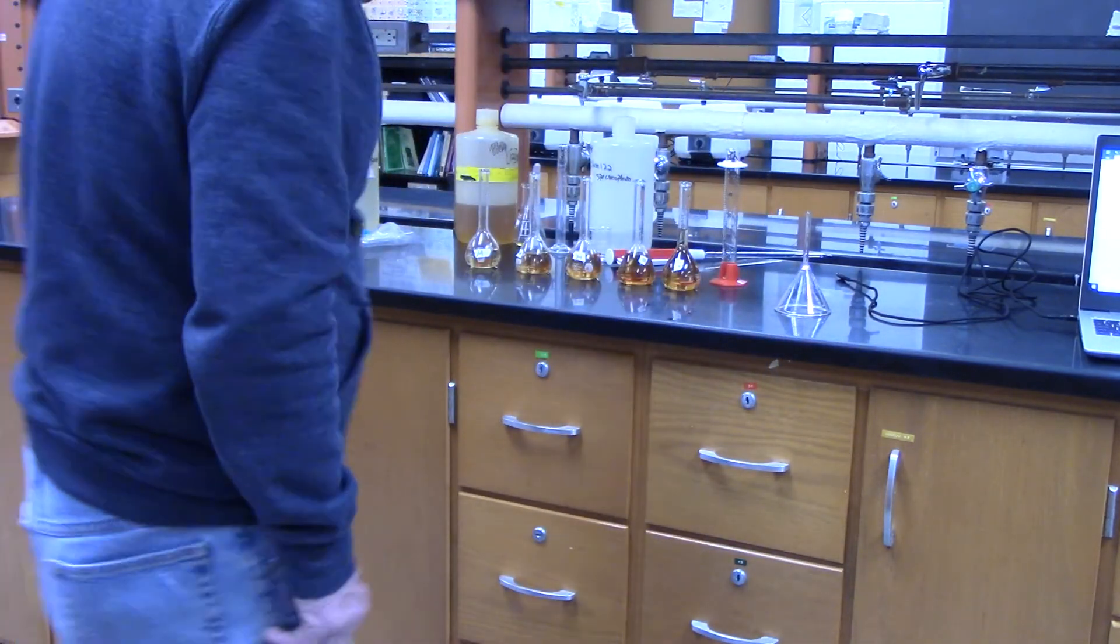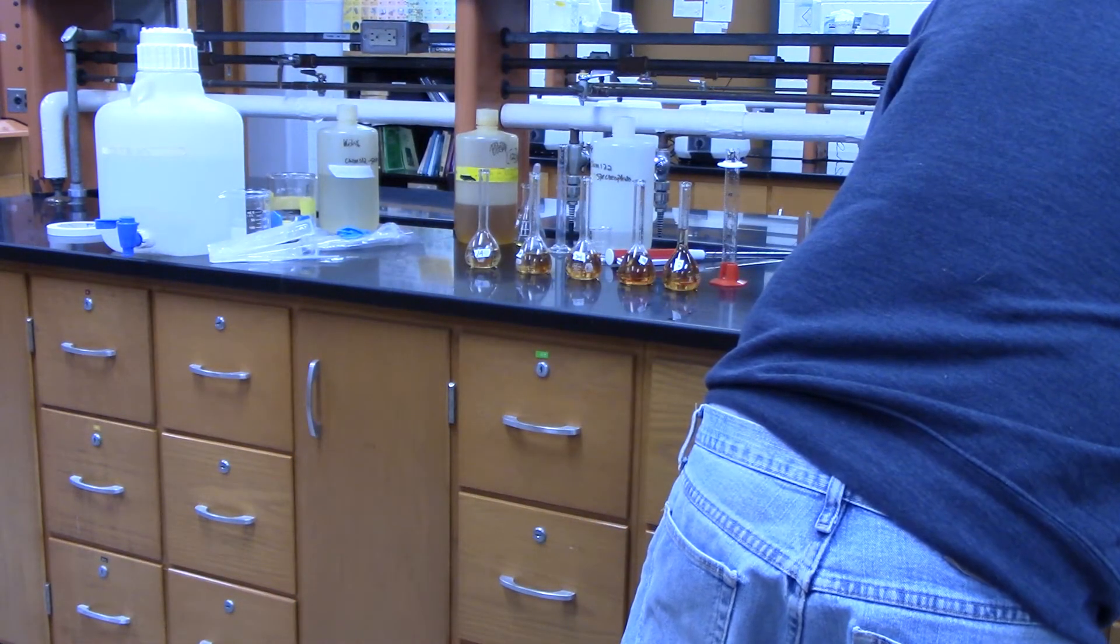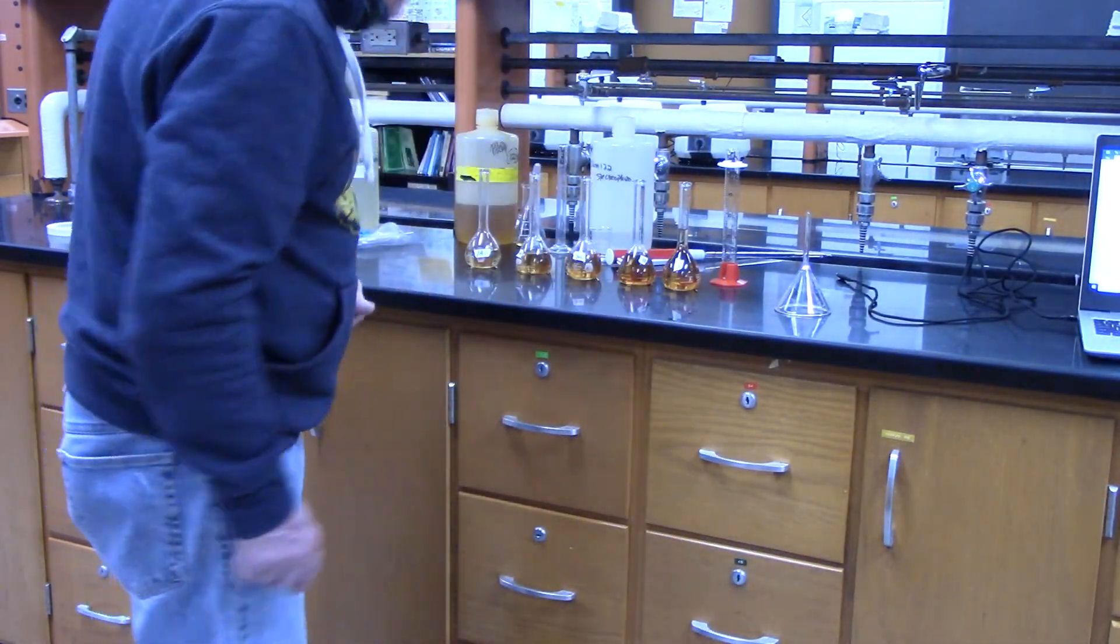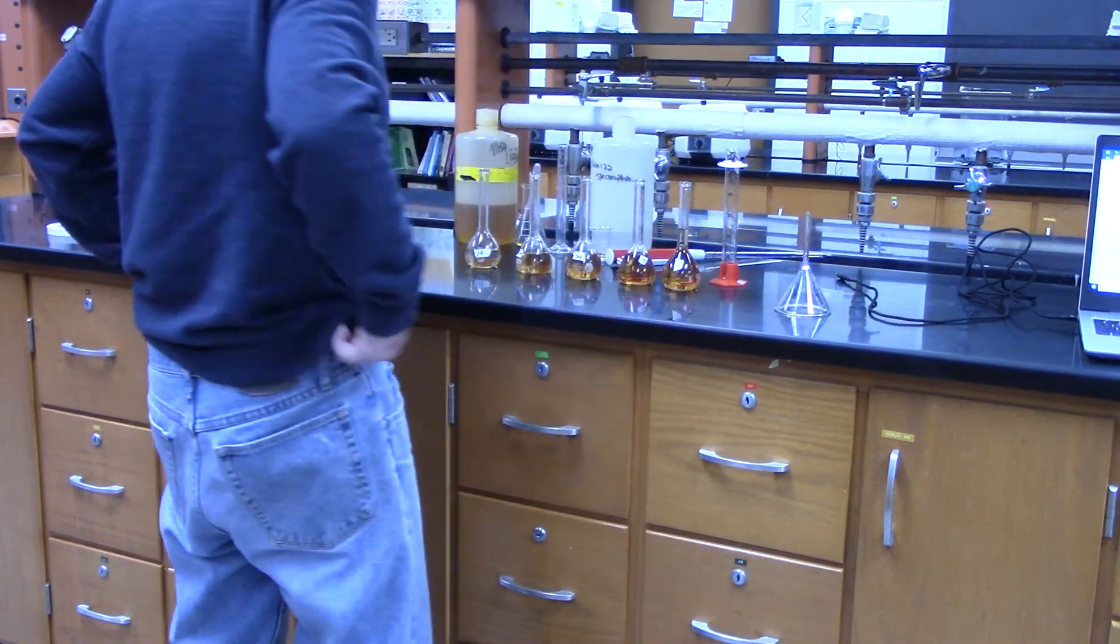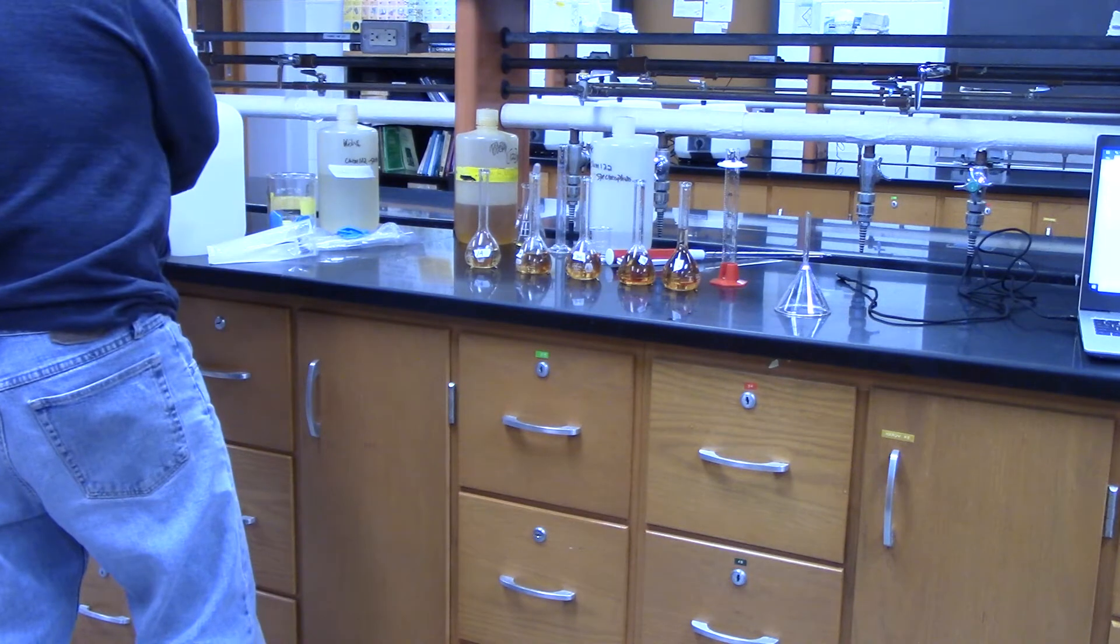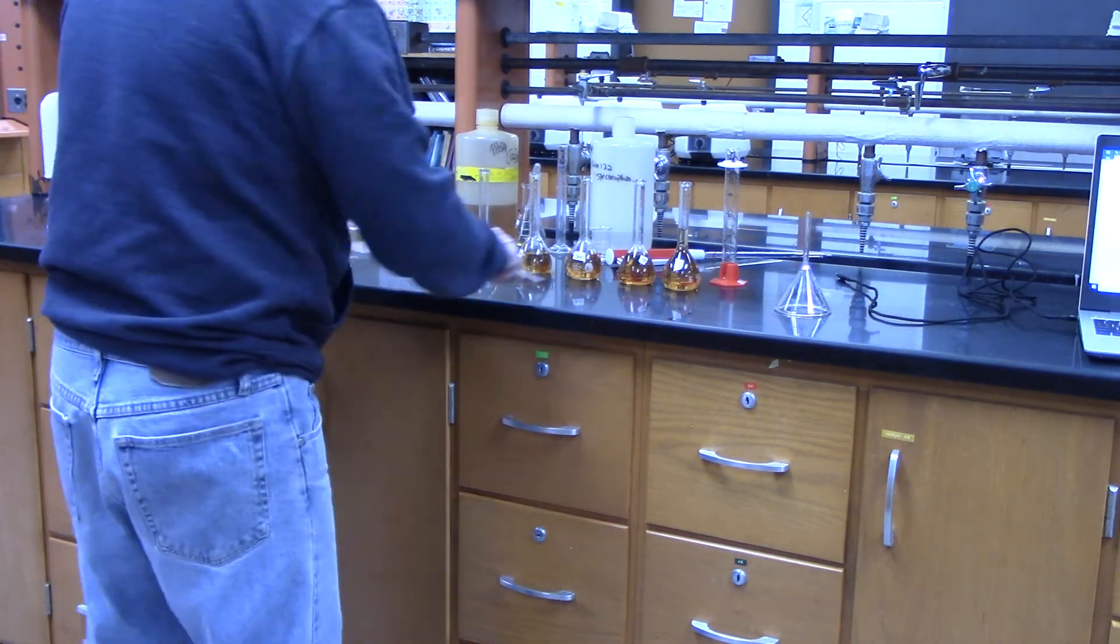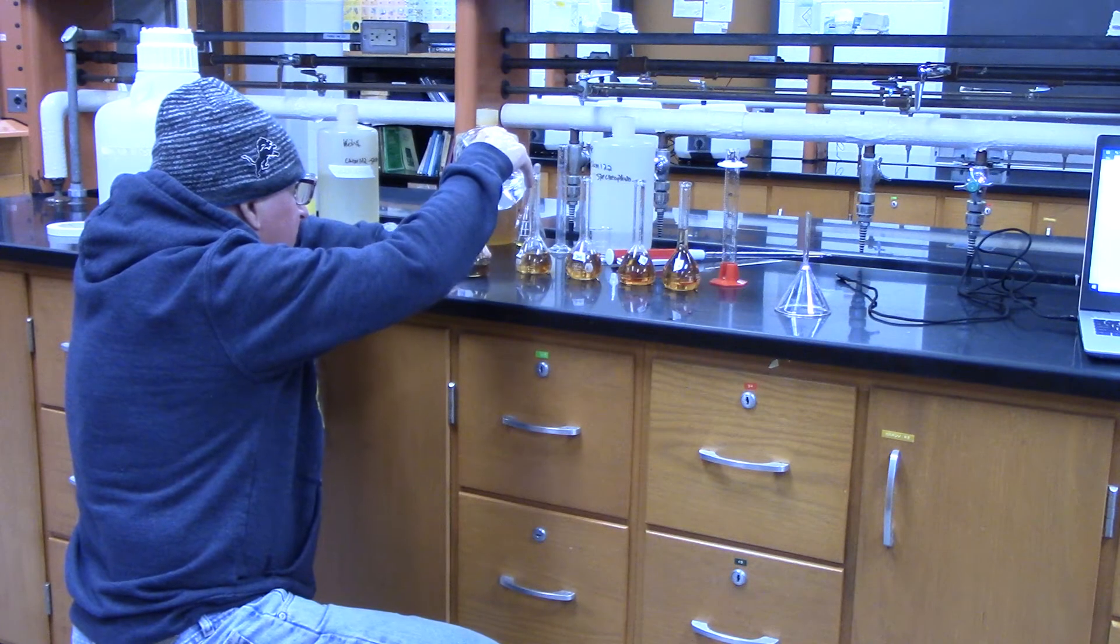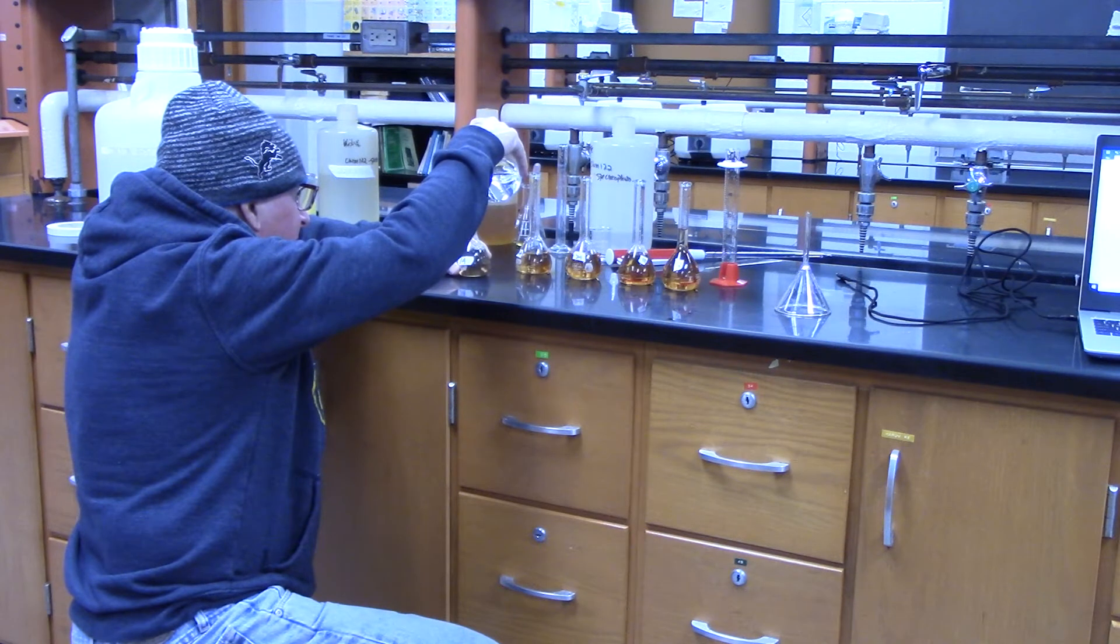Okay, all right. So I want to get them on each to 100. This one should be 100, but it's not, and that's only because some of it spilled up over. And the graduated cylinder, but I'm figuring all of them are going to have about the same difference. And so I'm not using a funnel this time. I'm filling up with the nitric acid like I did before.